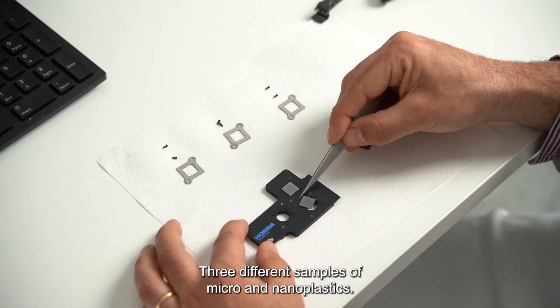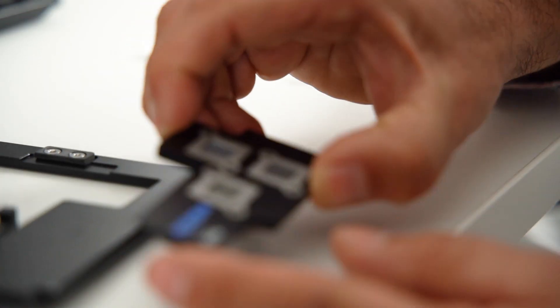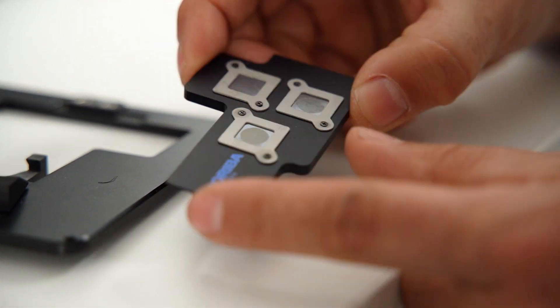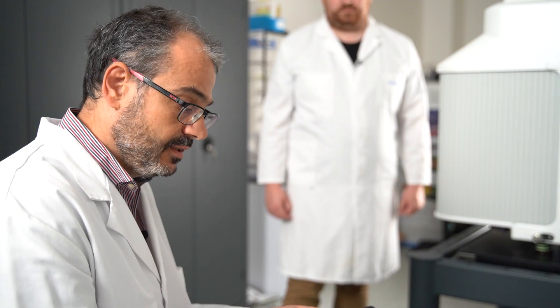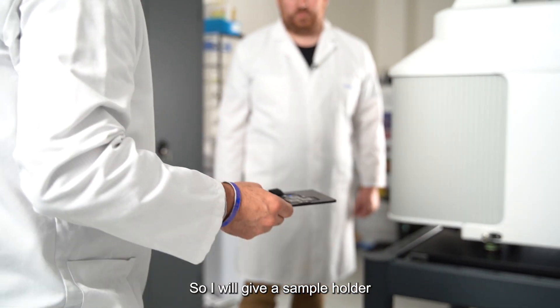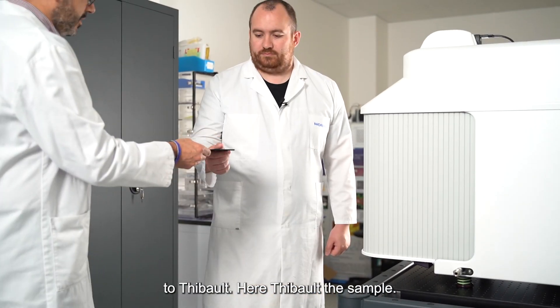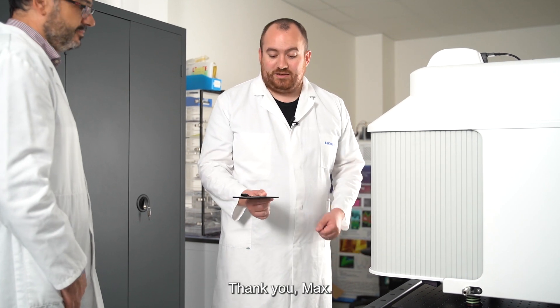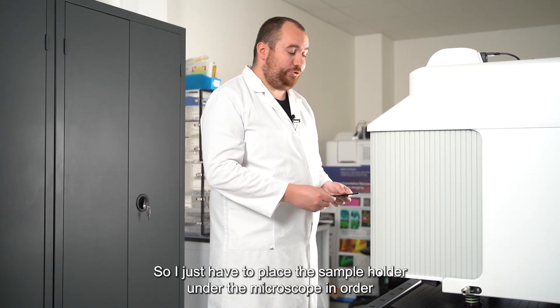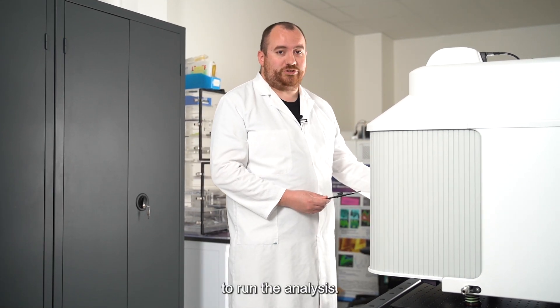Three different samples of micro and nanoplastic. I'll give the sample holder to Thibaut. Here, Thibaut, the sample. Thank you, Max. I just have to place the sample holder under the microscope to run the analysis.